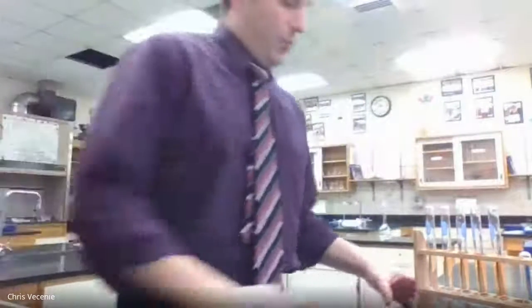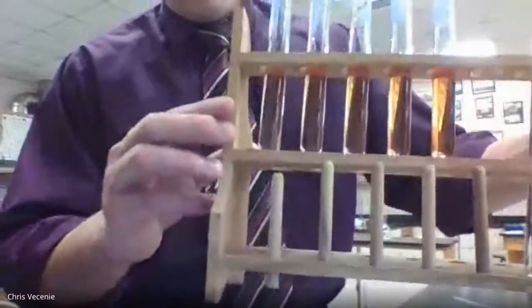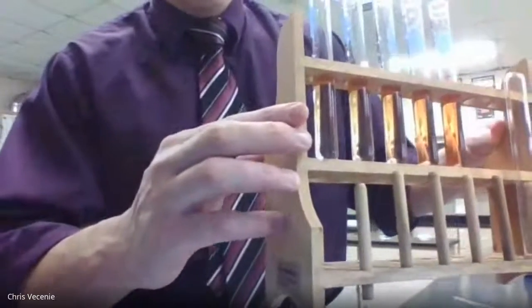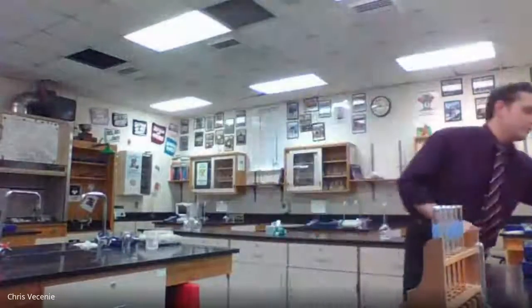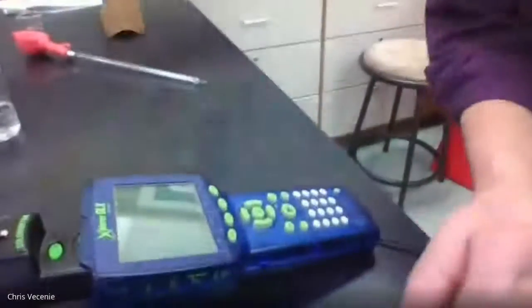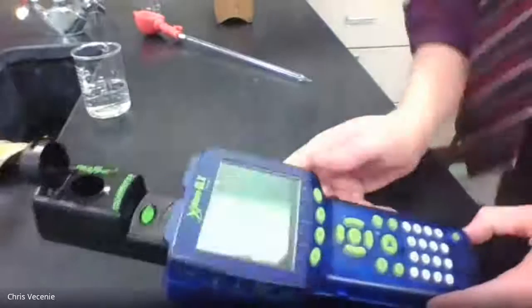Okay. All right, now if I bring these up nice and close for you. I'm not sure if you can quite see, maybe if I hold it like that, you can see they're progressively getting from lighter to darker, which makes sense because when we do this dilution, we're hoping to create an increase in molarity. Right? So in a perfect world, when I bring it over here, you will see hopefully that our absorbances go up when we do this. Okay, good. Just making sure you can see that.